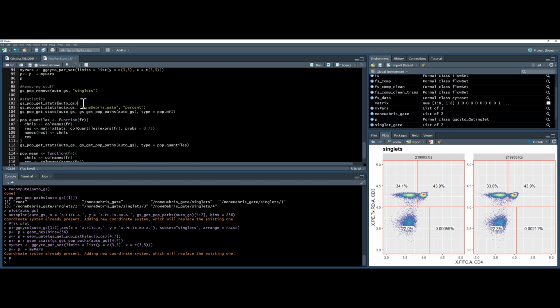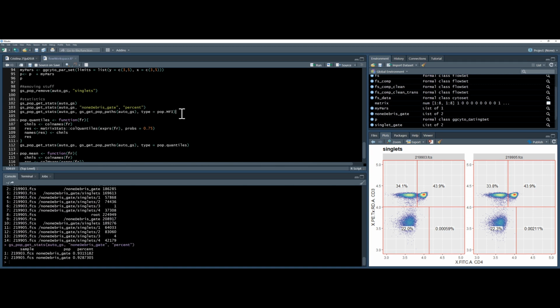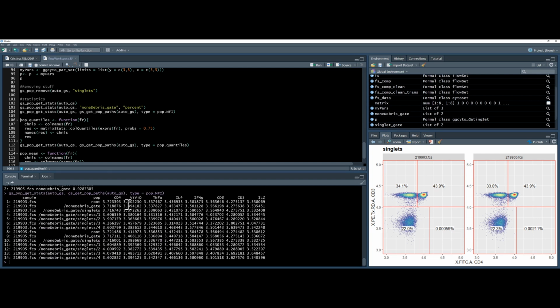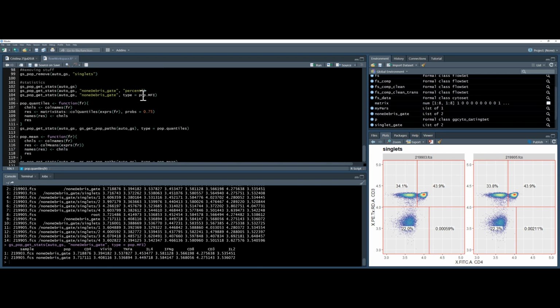Next, we can look at statistics. Again, we've done this before. These are the counts, these are the percentages, and there's a few different options. Instead of percent, you can type in population MFI, which will give you the MFI of each column and of each gate. I've got each gate because I'm telling it to load every single one here. I could have changed that to say the non-debris gate, or maybe to 1, and I wouldn't get so much data.